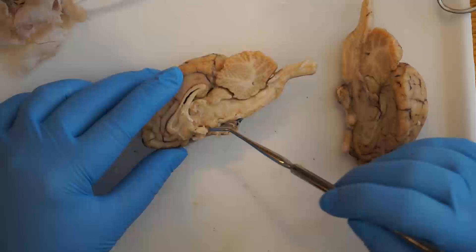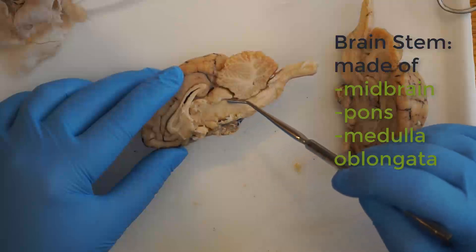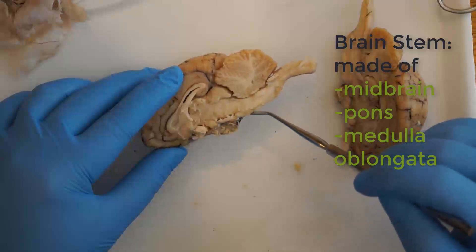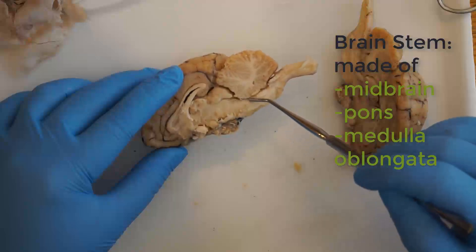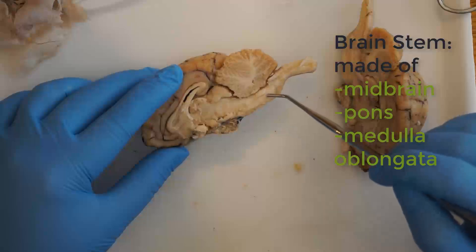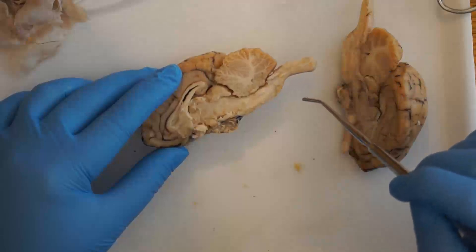Getting into portions of the brainstem, the first section is the midbrain, just beyond the thalamus, which relays information to your cerebrum about body movement and posture. You'll see a little bulge on the brainstem — that is the pons, which is the bridge linking the cerebrum and cerebellum — followed by the medulla oblongata, which transmits information between the brain and the spinal cord.